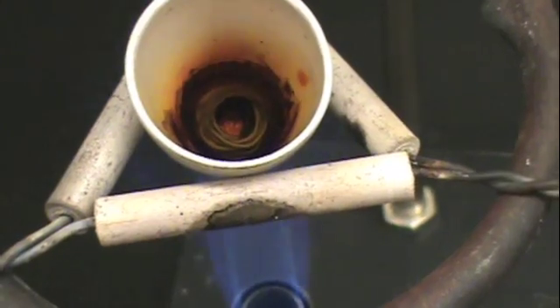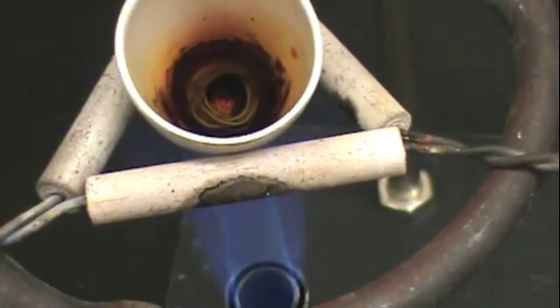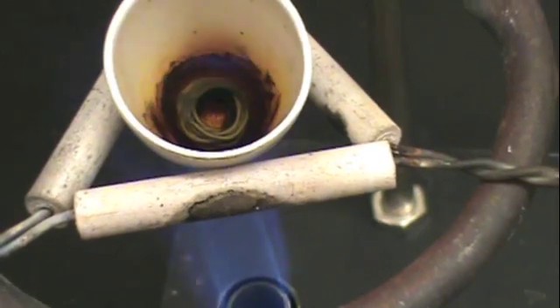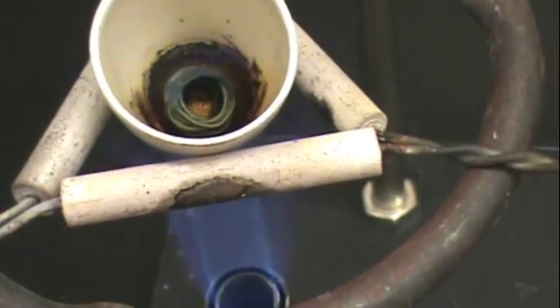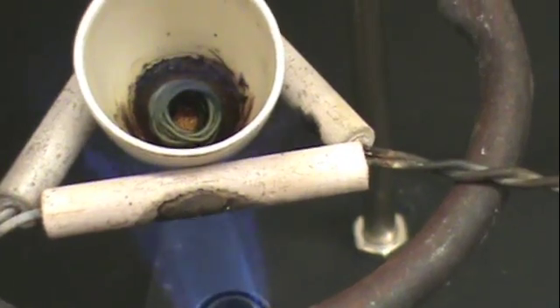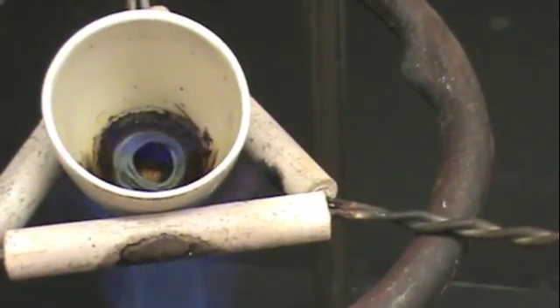Again, you will want to make sure that there is no longer any brown gas coming off when you finish heating, and it should look like a tarnished gray coil when you are finished.